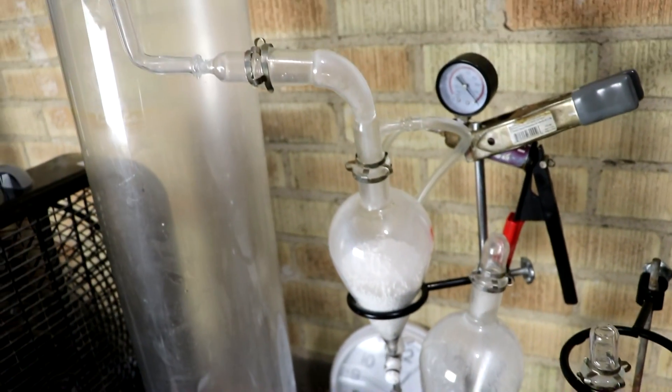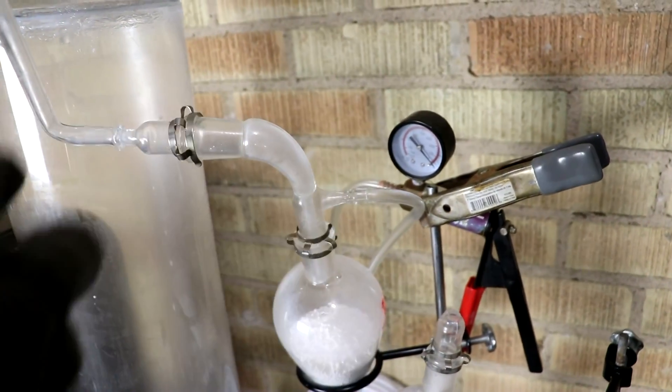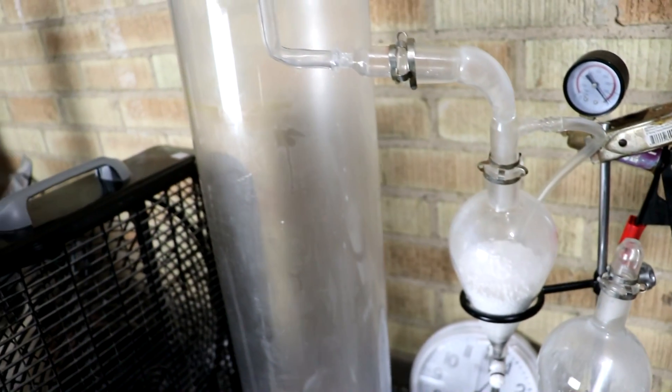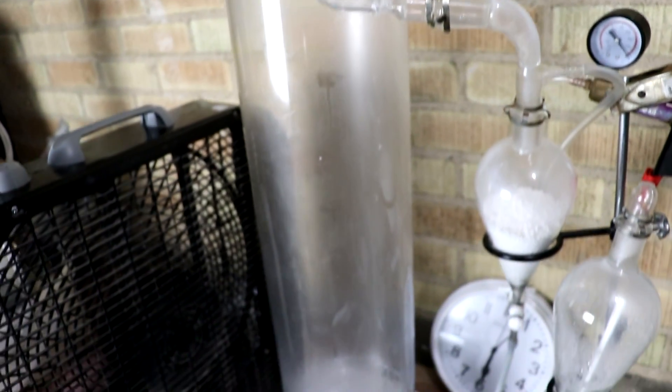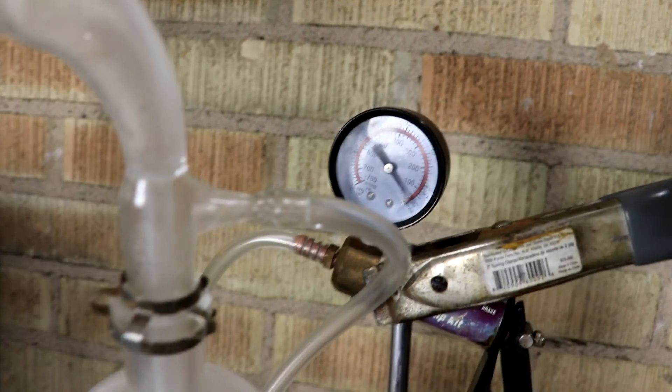Assuming there's no leaks, this should actually pull a vacuum as the gases react and form the sulfuric acid. It is pulling a vacuum, so it's working.